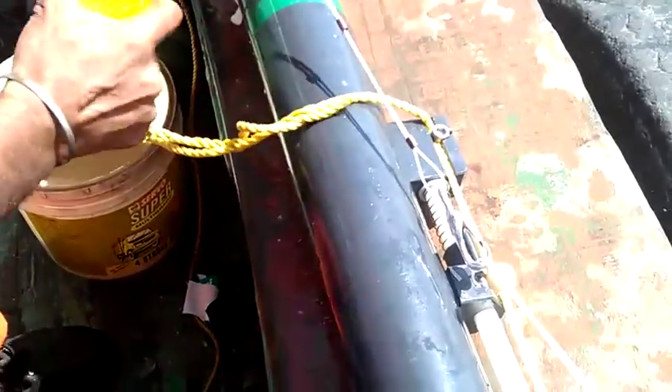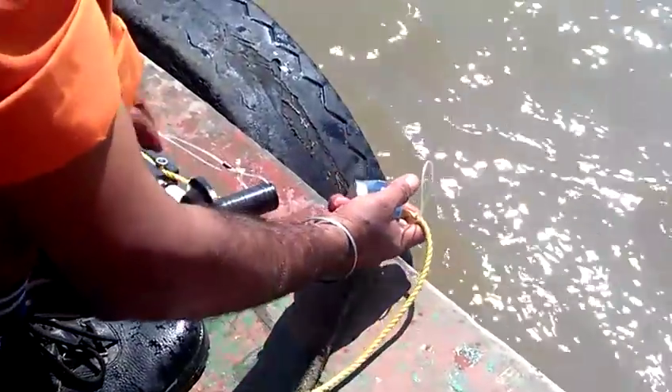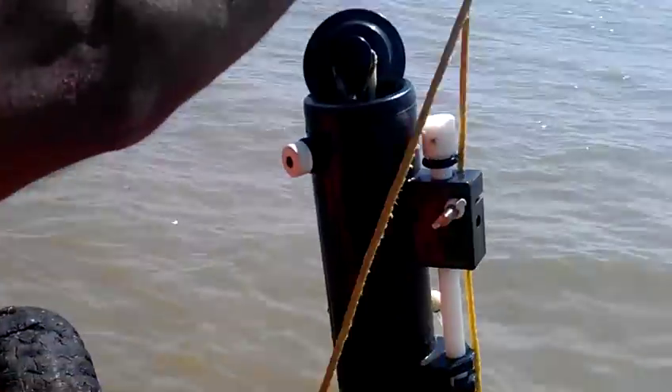Once it's completed, you have to check the weights. Here the lock. Hold on the messenger. Here the lock also. And clear the lock so that it doesn't hit up with the clutcher.